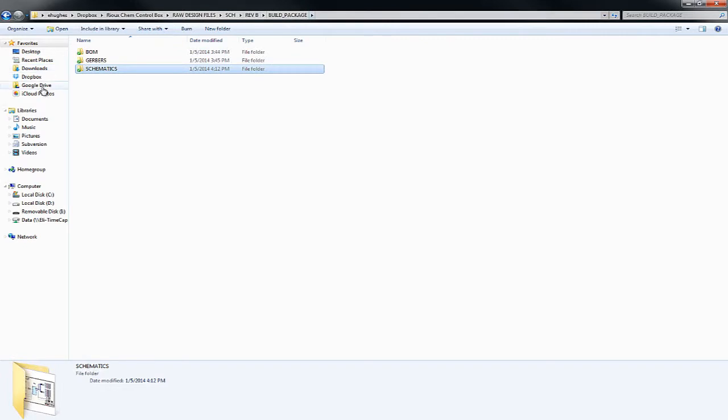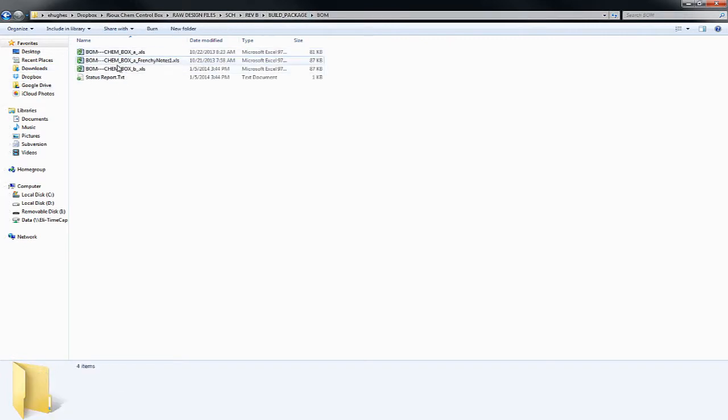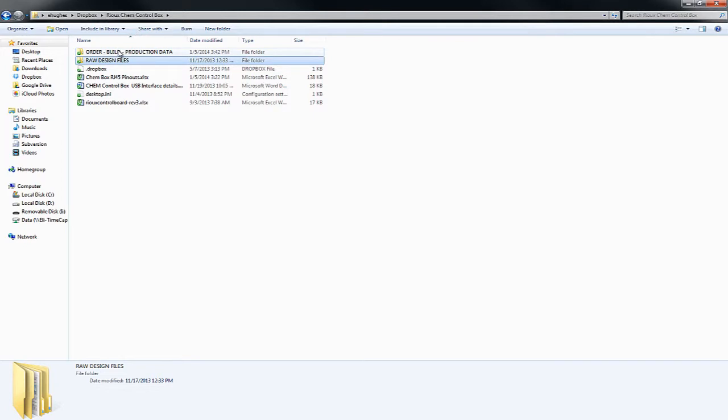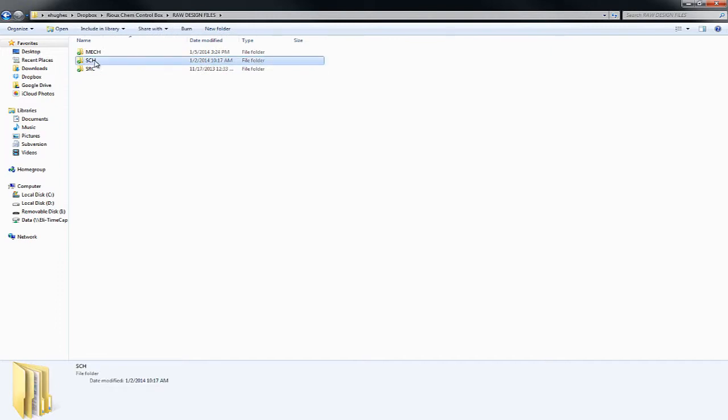The other things that are going to be in here are the raw bill of materials and the Gerber files. Now, if you're ordering more parts, you don't want to grab from here. I've got another place, under order, build, production data. That's where you actually want to go, and we're going to look at that a little bit later.